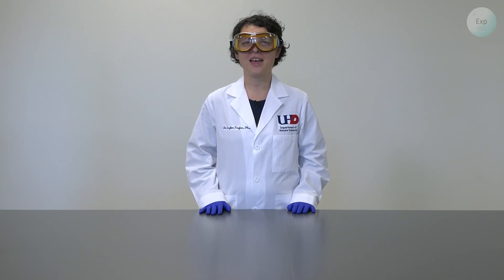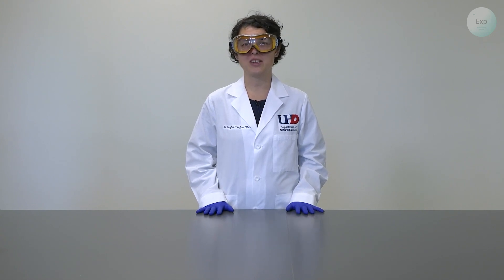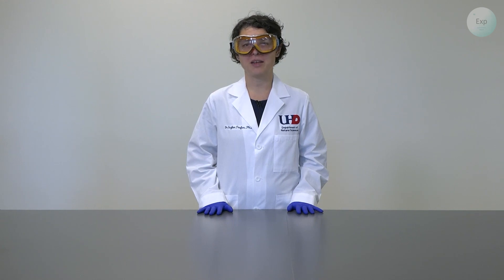Hello, my name is Dr. Esther Trufan, and in this video, I'm going to demonstrate how to make a 500 milliliter 0.1 molar sodium hydroxide solution.